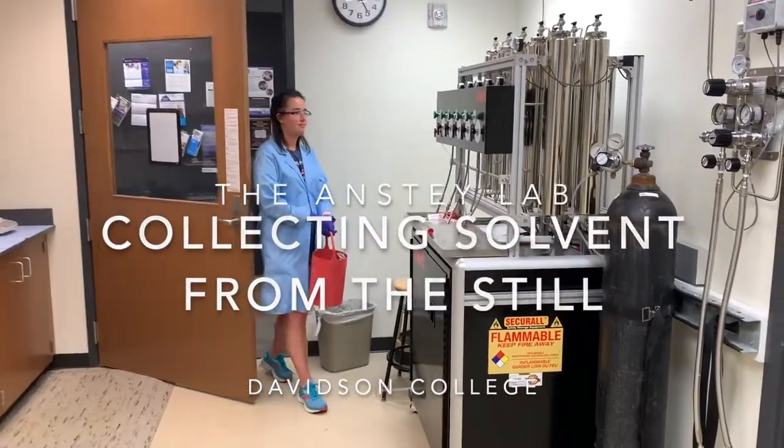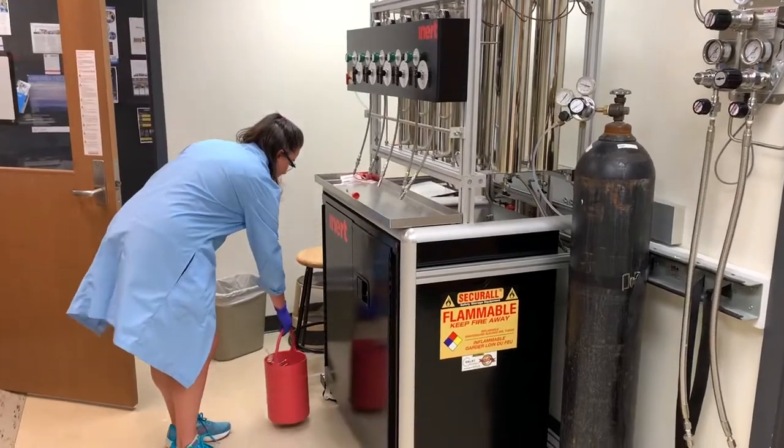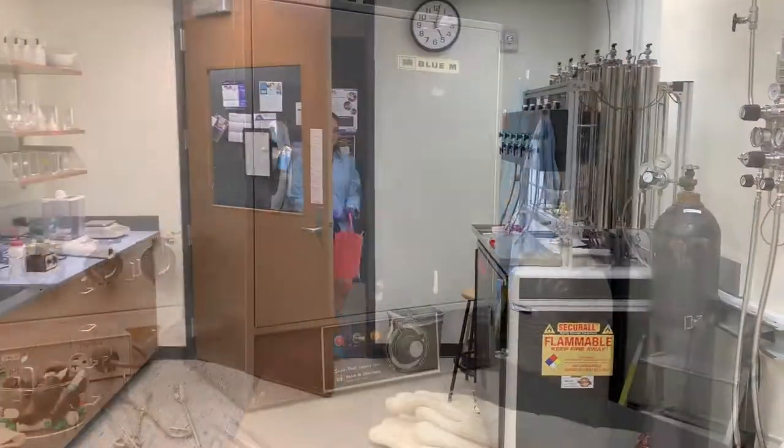Oh hey Alexa, it looks like you need some dry and deoxygenated solvent from our dry solvent still. Well to do that we need to back up a bit.